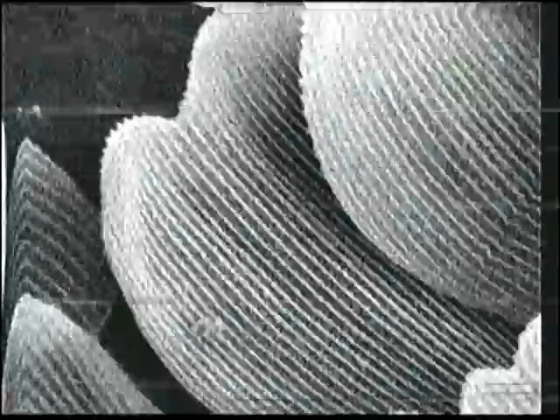So that's the wing, and then it's got the smaller wing platelets on the wing, and inside those platelets there's large struts, and within those struts, it's possible that if this machine were working better, and I'm trying to tweak it, but that's the highest magnification, you could actually see struts that run parallel to the big struts between the little struts, and I think I'm actually seeing those in this video. Actually, right now the video is much better than the screen. I'm liking the video better.